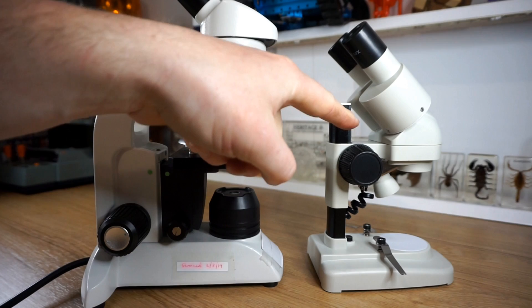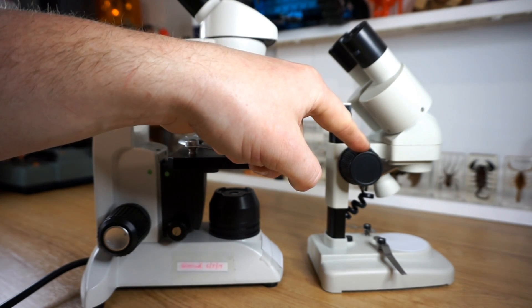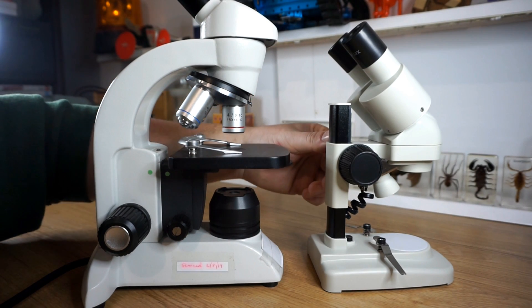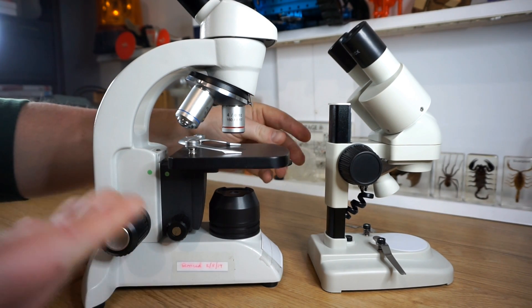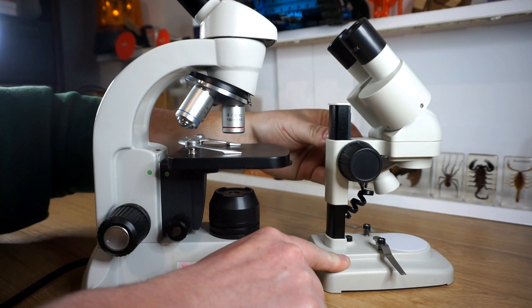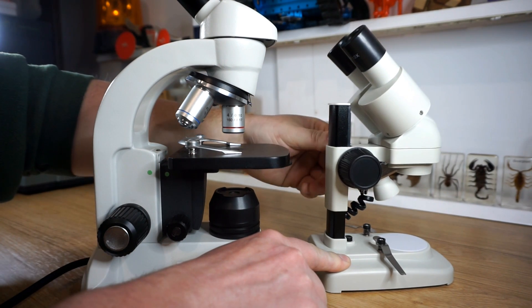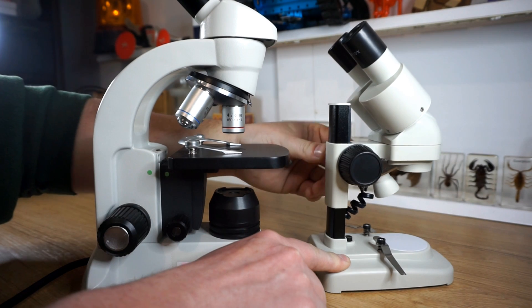This particular stereo microscope only has one coarse focus knob — it doesn't have a fine focus. As I rotate this one, you'll notice that instead of the stage moving up and down, this whole section that you look through moves up and down, and that allows you to focus on what you're looking at.